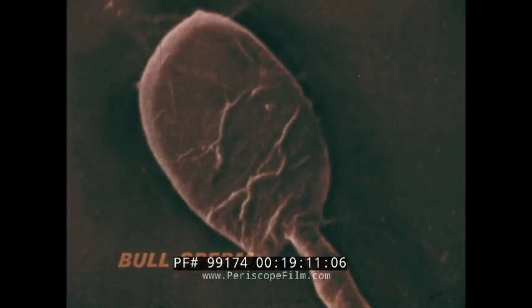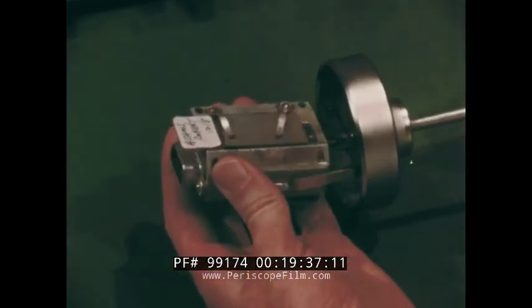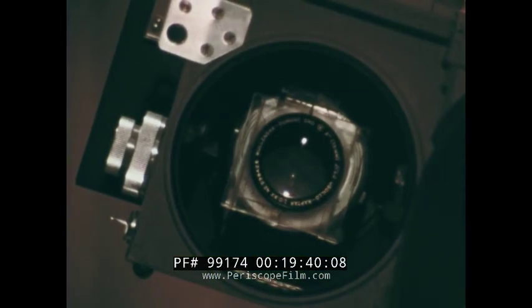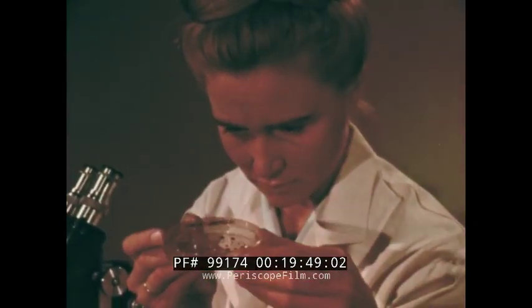The full possibilities of the scanning electron microscope are still being explored. For example, this image of the flower beetle may be modulated by assigning a particular color to a particular intensity, thus getting a color image, not a color picture, since we are not dealing with visible light, but a kind of color diagram like staining, which greatly increases the amount of subjective information. Because finally we see not with instruments, not even with our eyes, but really with our brain, with our whole life experience.